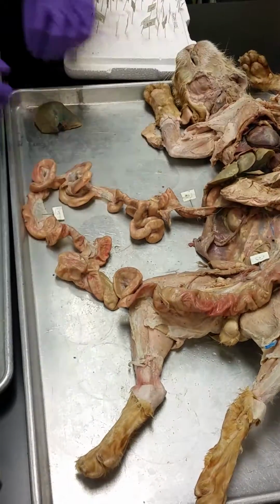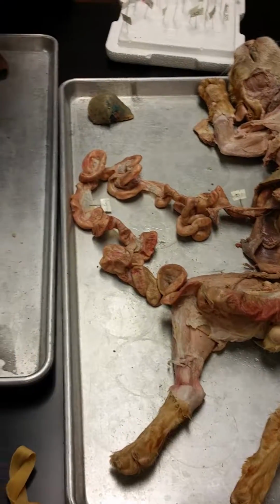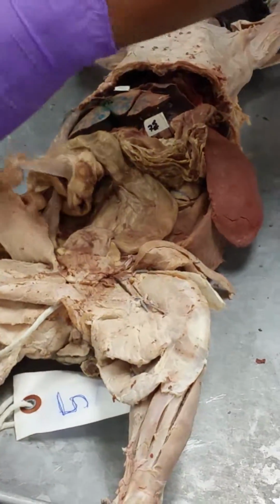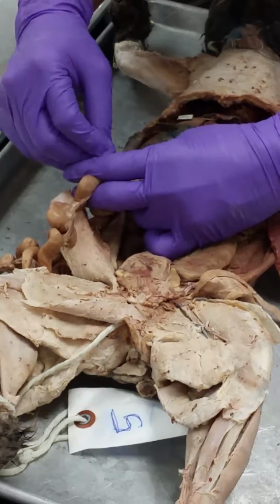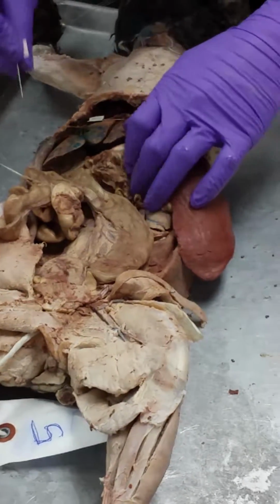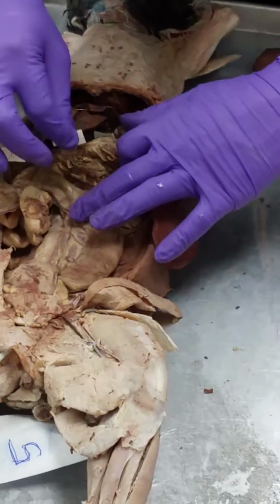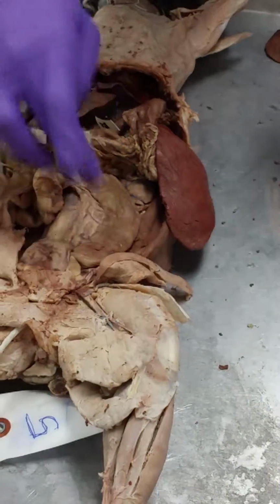Cecum. And the very first segment of the large intestines is the cecum. The cat's large intestines isn't developed like the human is. So here's small intestines, right? Large intestines all together. So that first little nub right there, that's the cecum. Ascending colon. Which is really short, just this little bit right here is ascending colon for the cat. Transverse colon. And the transverse where it comes across right there. Descending colon. Descending, coming down here.